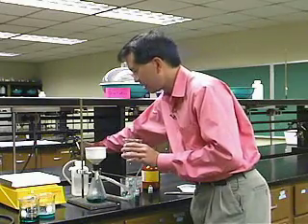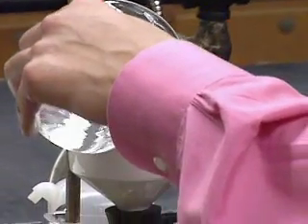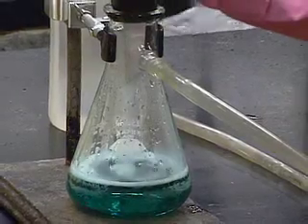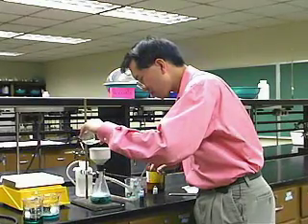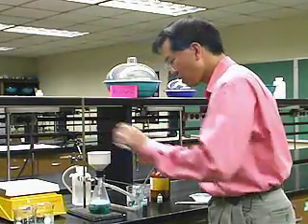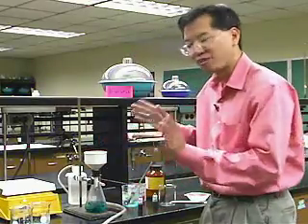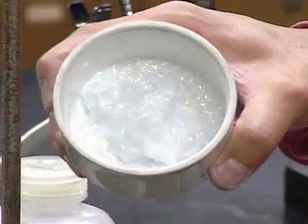Now we're going to add a little bit of water and wash the crystals. This ideally would be very cold water because, again, the crystals are not soluble in cold water. But let's do that. And then when I'm done, I'll show you that the crystals are pale or colorless or nearly colorless. All right. So all I did was wash the crystals with some cold water, and ideally I would have used very cold water. But now you can see that the crystals are almost perfectly white.